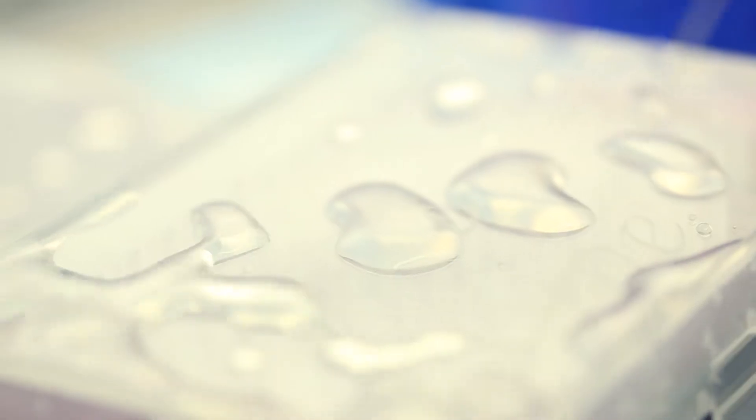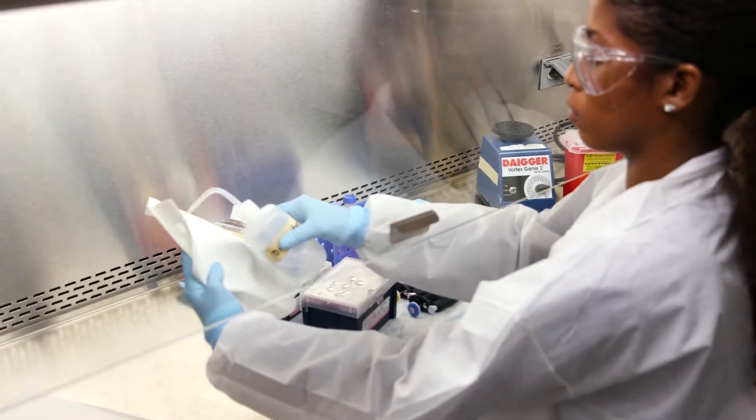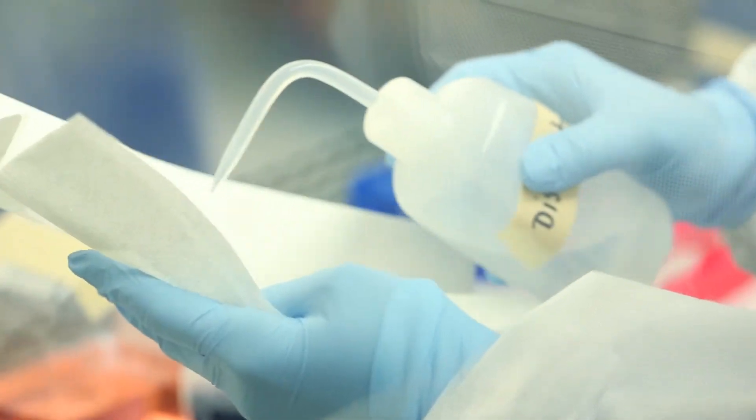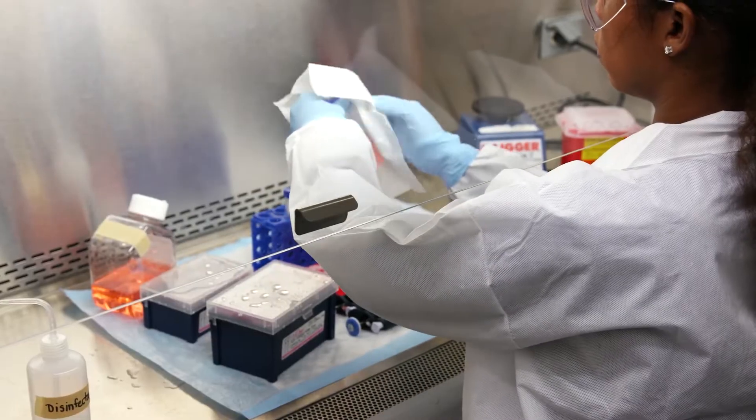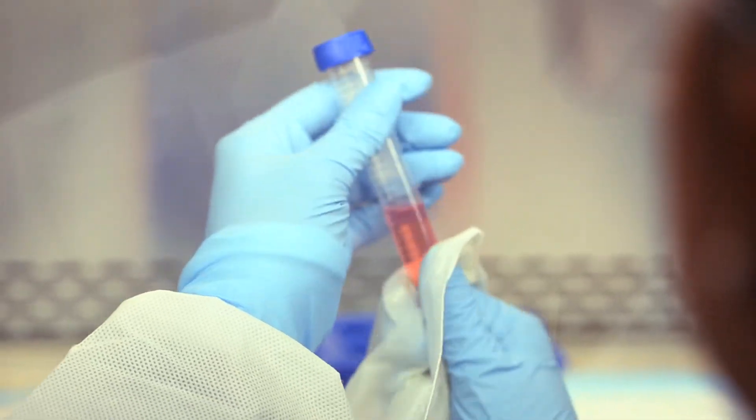This can be done directly to the materials or by moistening a towel and wiping the surface of the materials, starting with the least contaminated items first.